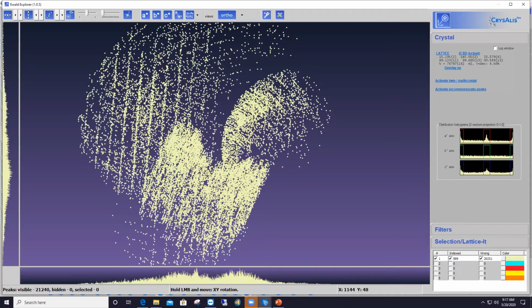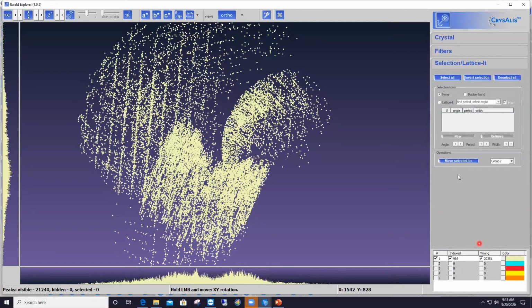All right, back to work here with our IC datasets. So now to apply Lattice-It to those rows of reflections I just determined before, I'm now going to the Lattice-It tab on the right-hand side panel at the bottom. And I click on it to expand it. And I enable the Lattice-It feature by checking the box in front of it. Okay, this little box here, I click on it.